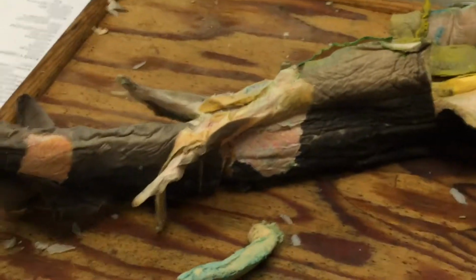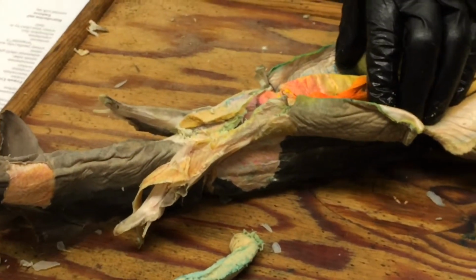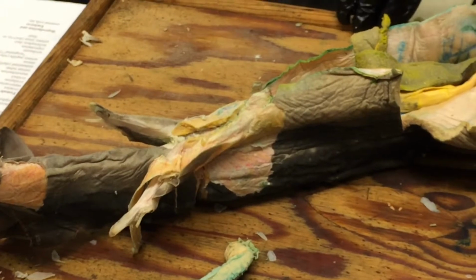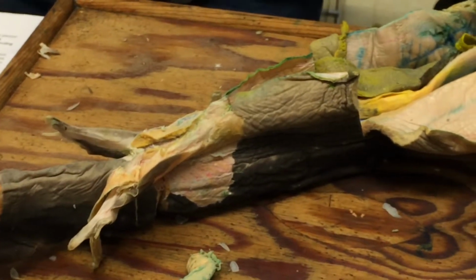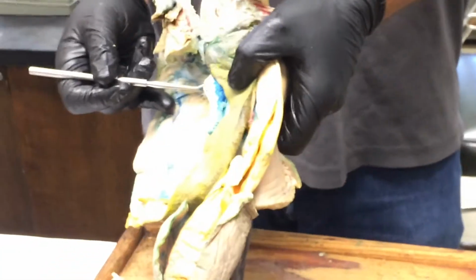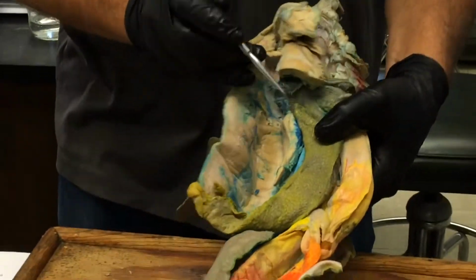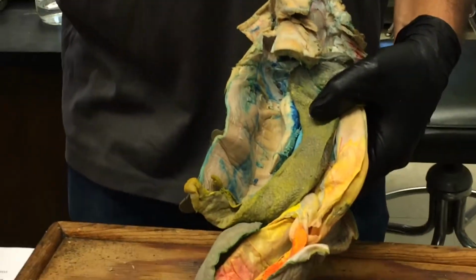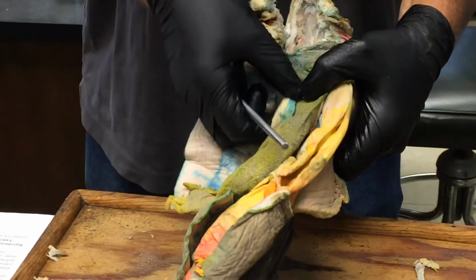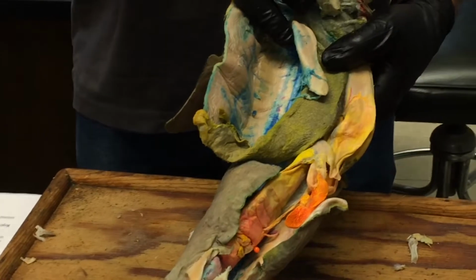Archinephric ducts, in general, yes, they exist, and we'll look at them in more detail in a moment. And the cloaca we already know. So let's go through then the male. And this is a male. What's this big thing here? Testis. Everyone agree? Okay, so there's the testis. And it has a mesentery that holds it to the body wall, and that would be called the mesorchium.